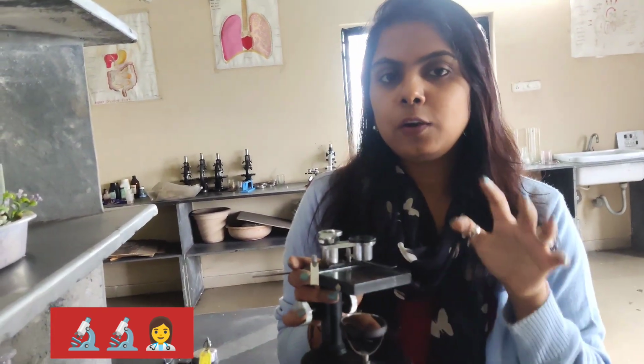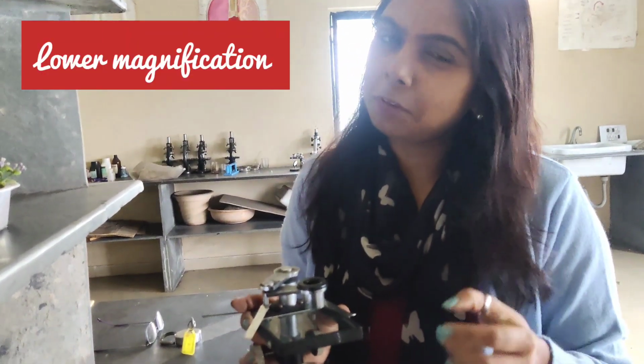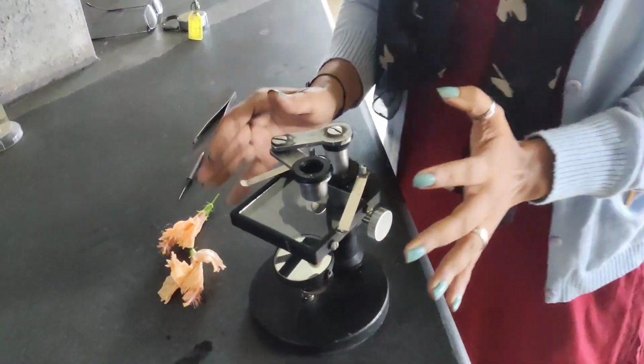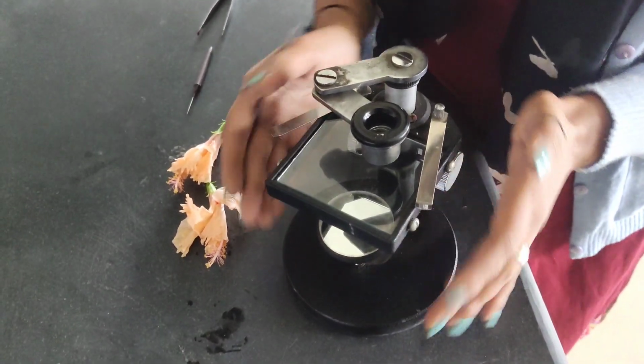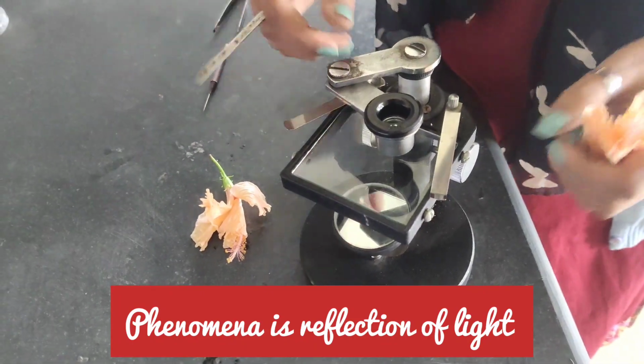We use it for very lower magnification. It's an optical microscope. Now let me just show you by using a specific specimen that how are we going to investigate it under this lens. So here, you know what happens in this? So there is a reflection of light from the surface of object rather than the transmission part. Only the light is being reflected by whatever object you are keeping over here.